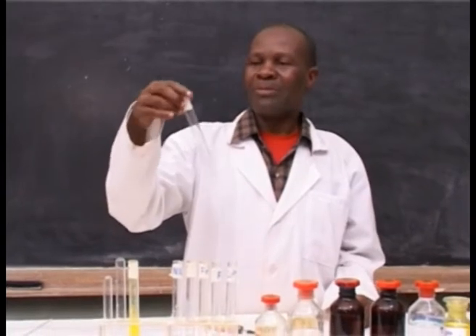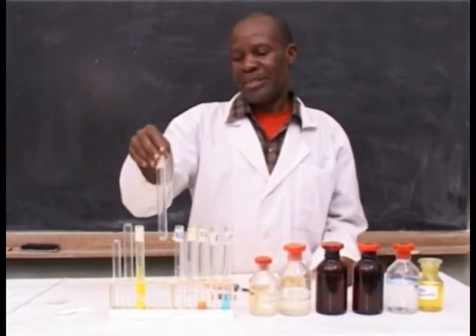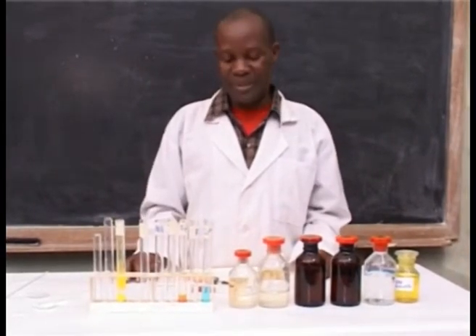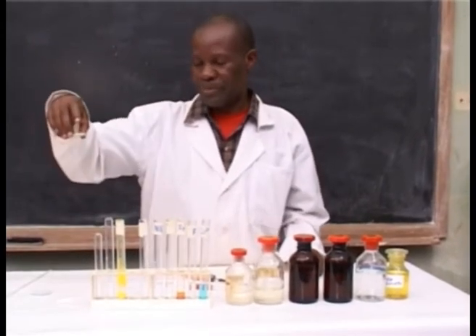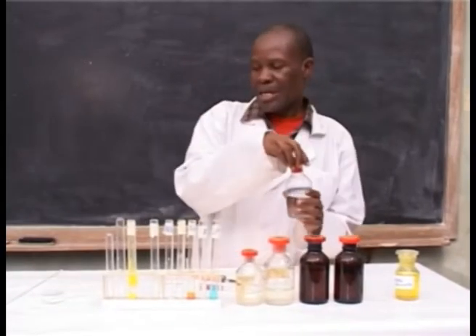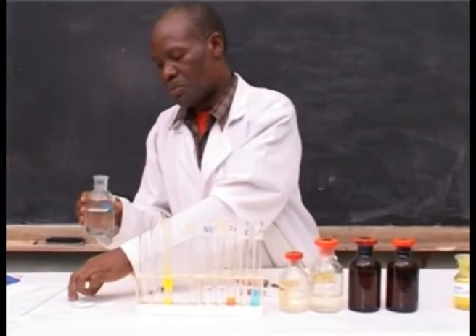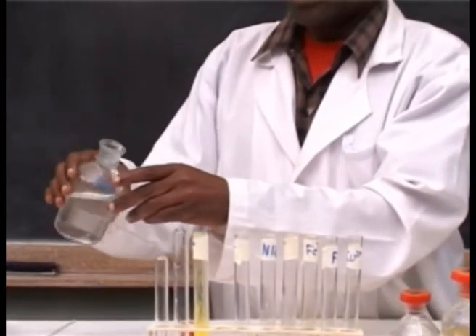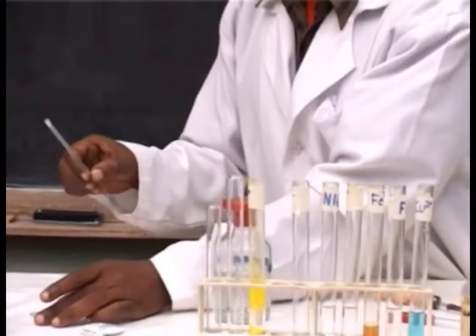To confirm calcium ions, this will be confirmed by using a flame test, and you have to use a solid sample. Take dilute hydrochloric acid and put it on the watch glass. Take the glass rod.